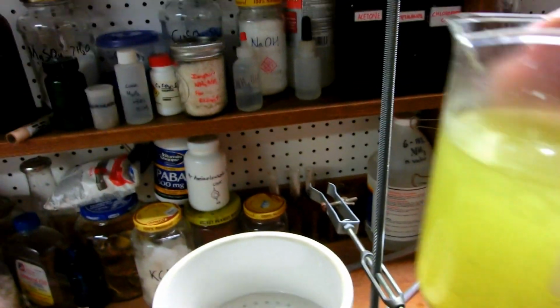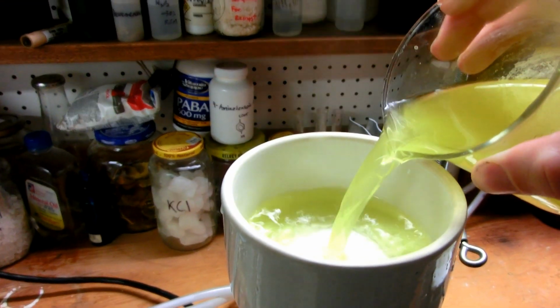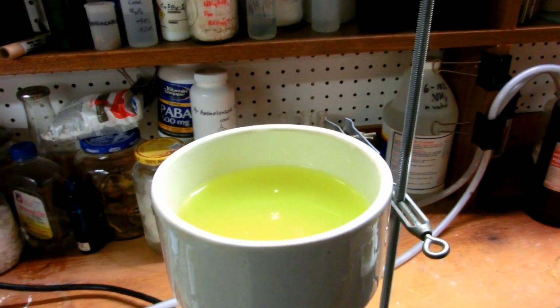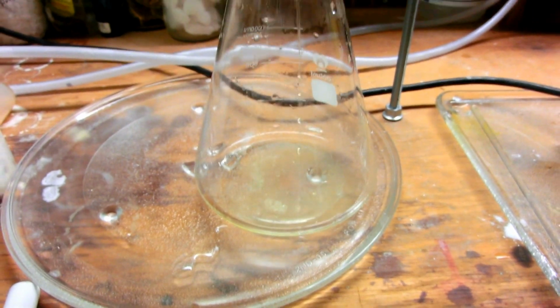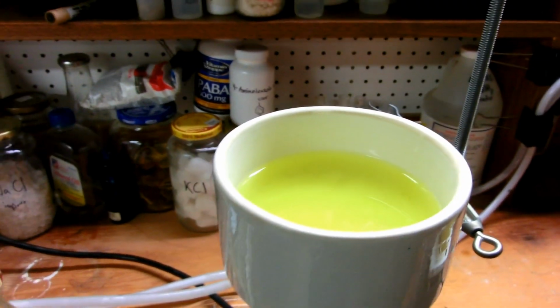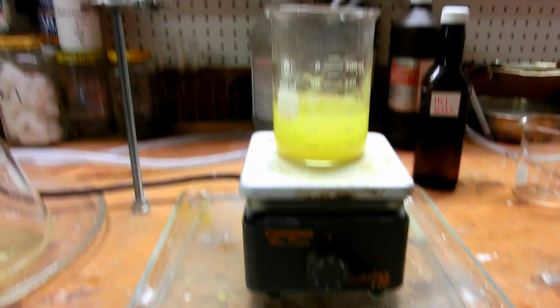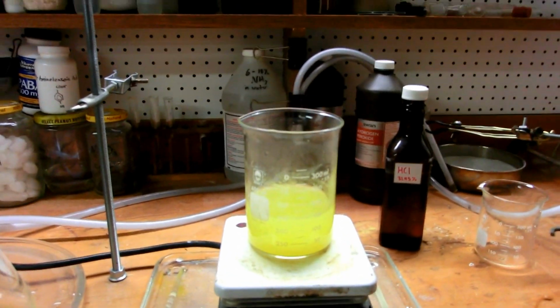And we'll just take the hot acidic solution of iron oxalate, and we'll pour it in here. Keep the rest on the hot plate. And through here we should be getting a perfectly clear solution if the reaction went to completion. And up here we'll be capturing our iron oxalate. Now I'm going to put the camera back on the tripod. And it's going to be super noisy, but I'm going to crank it up.